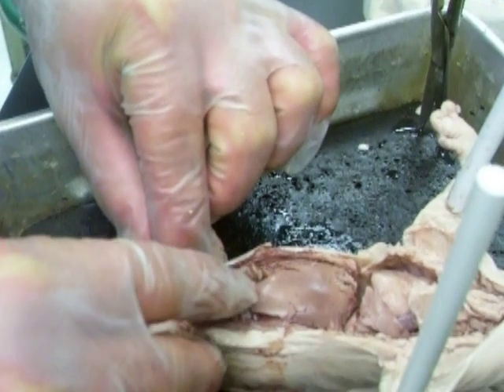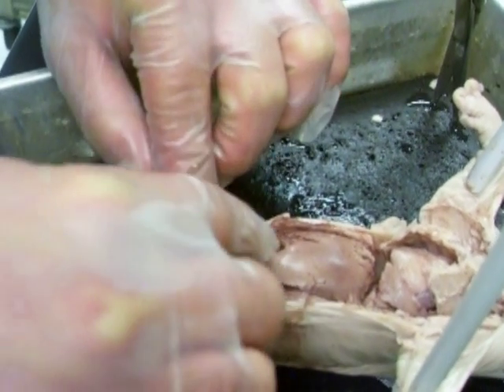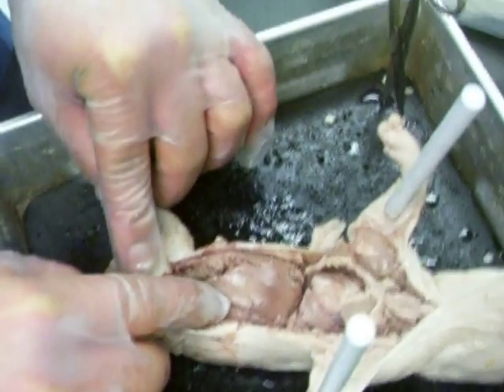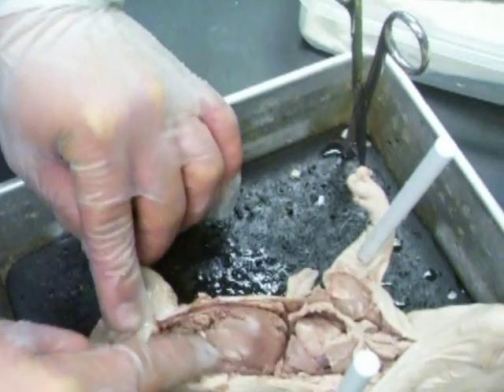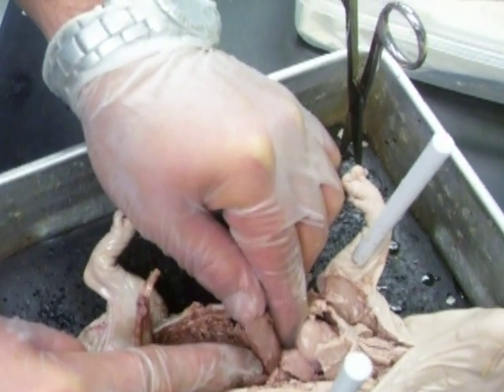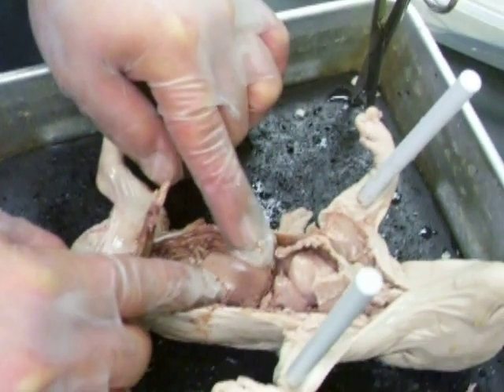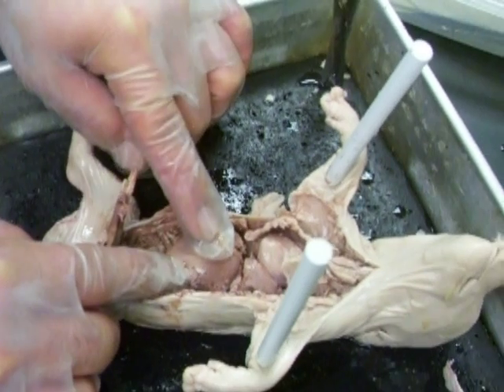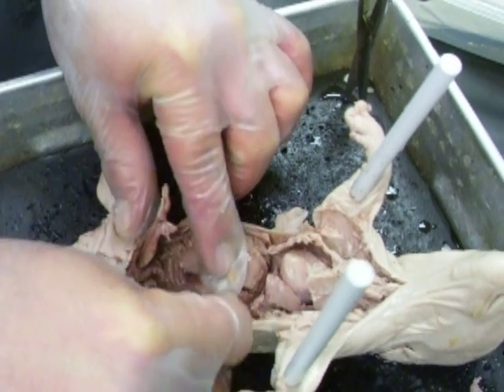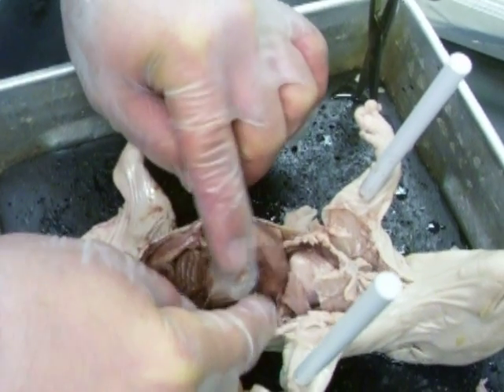Yeah. And under that, you see... what's the intestines? This is the small intestine over here. This is the large intestine over here. And then his stomach is behind, right here. And this is the right lobe of the liver — basically the liver. His spleen... that might be his spleen.